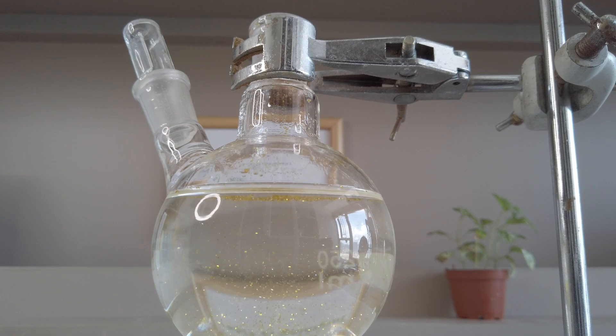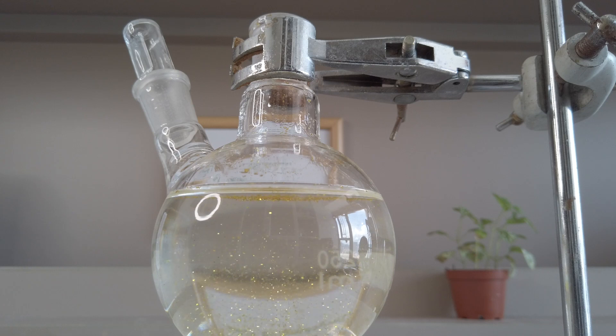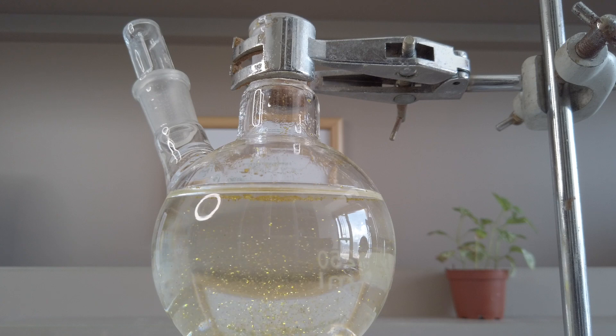The lead iodide solid shines like gold flakes in water. Therefore, the reaction is also known as the golden rain reaction. It's gonna be a long time lapse.